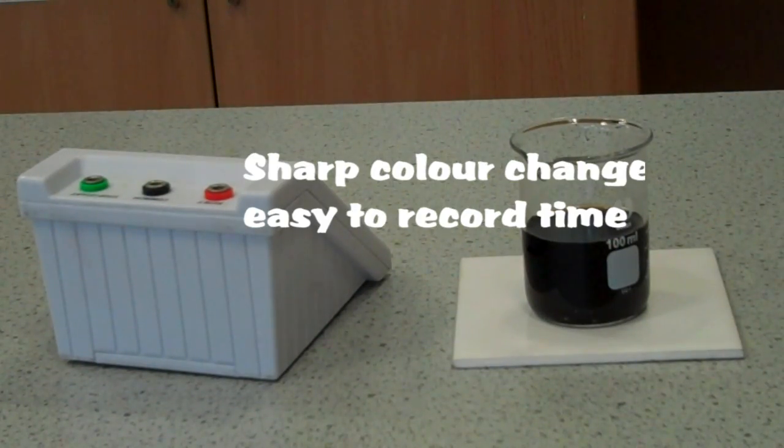The sharp color change makes determining the reaction time more accurate. This is because it was easy to recognize a distinct color.